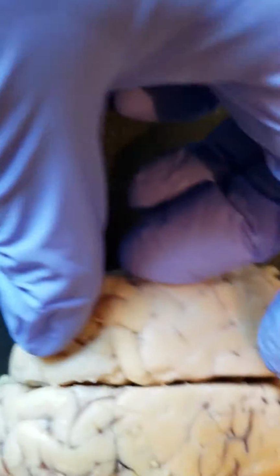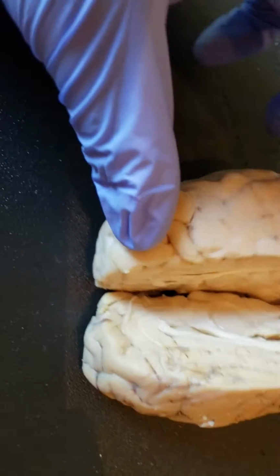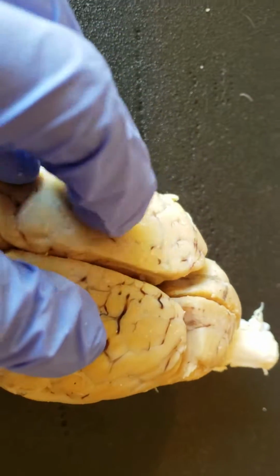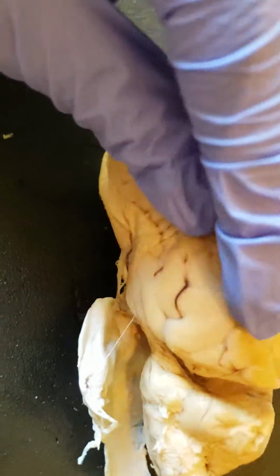So, obviously, this is the front of the brain, if you're looking down on the top of the sheep head. And then here, right in the front, the frontal lobe, and this little thing separates the frontal from the parietal. Parietal is these two on top. Move it over to the side, and you've got the temporal lobe, which I've tried to separate.